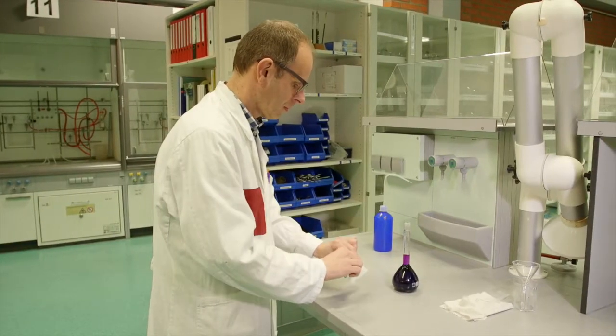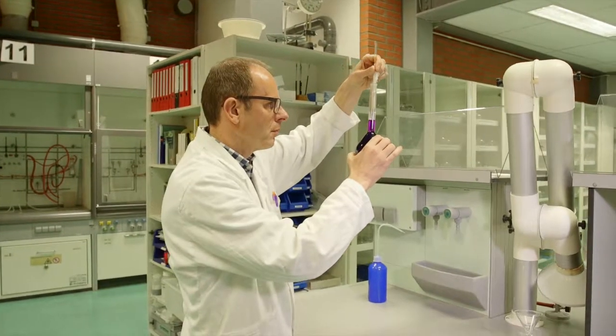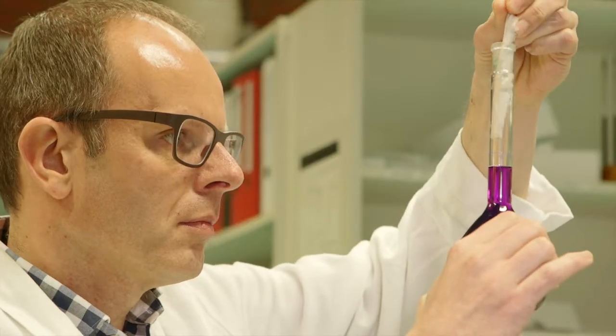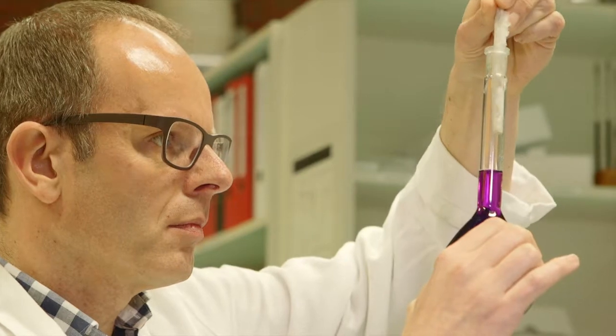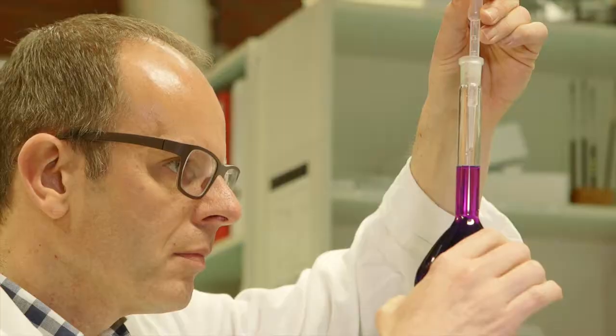A small piece of tissue is placed around the clean and dry stirring rod to dry the neck of the flask. The neck is only dried above the line. Using a Pasteur pipette, the solution is filled until the meniscus is brought to the line.